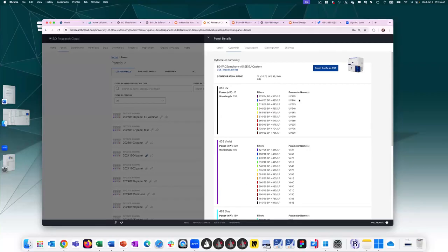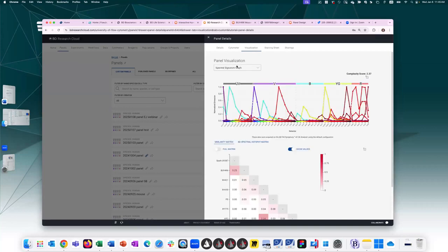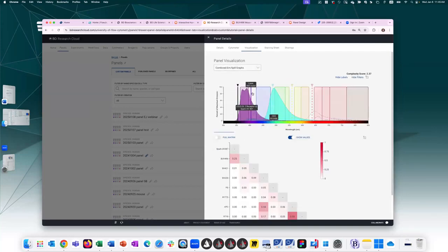If I click on cytometer, it shows me which cytometer was used to optimize this panel. I can click on visualization to get back to the spectral view. I can click conventional, reassess. So after staining, if you do see you're running into problems, you can come back and say, oh yeah, I didn't really anticipate this. That was not a great decision. Let's use this as a base and make a few simple swaps.